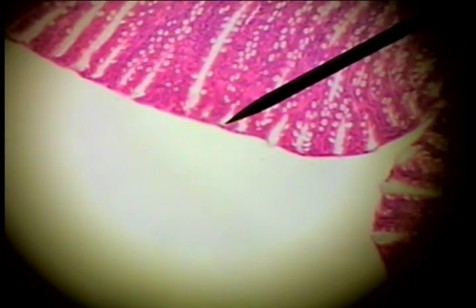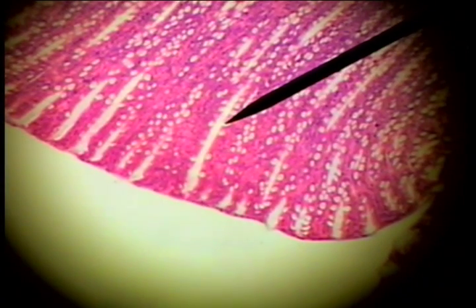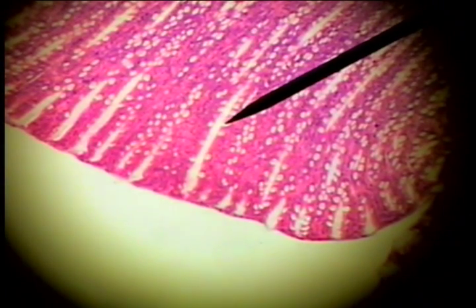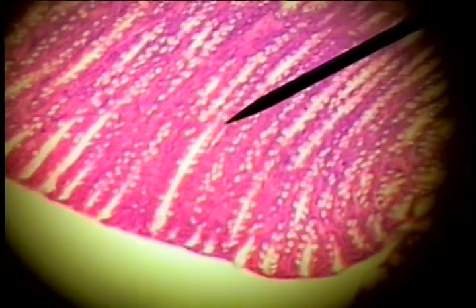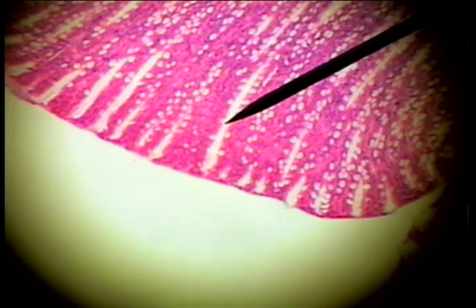The surface of the colon doesn't have fingers. It has small openings at the surface, small circular openings, and crypts of Lieberkühn. And down along the crypts, we can see the epithelium type.